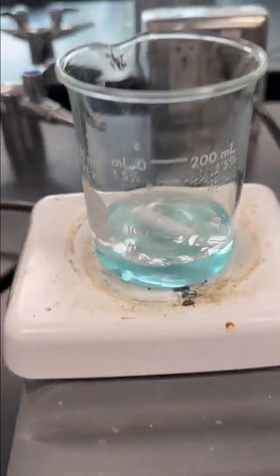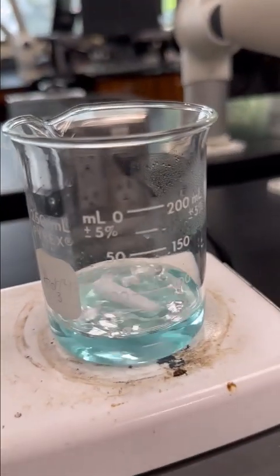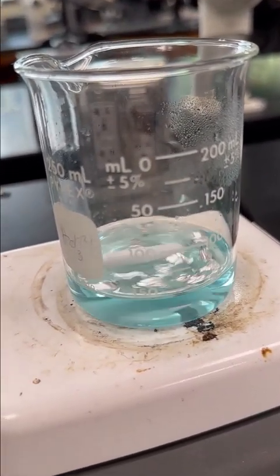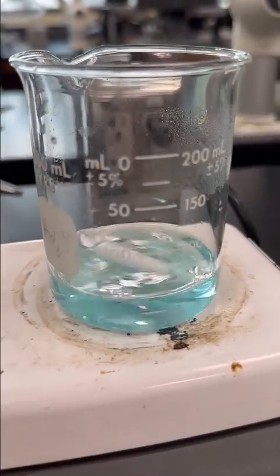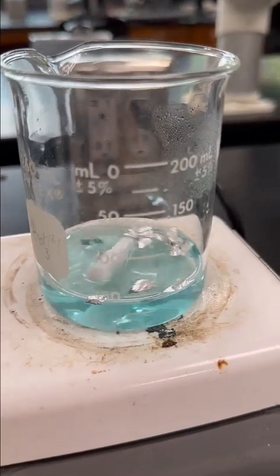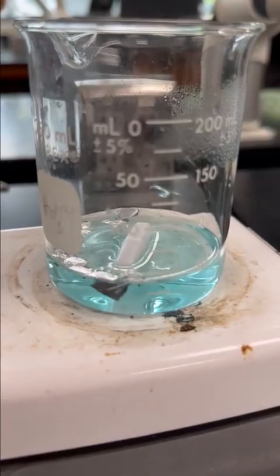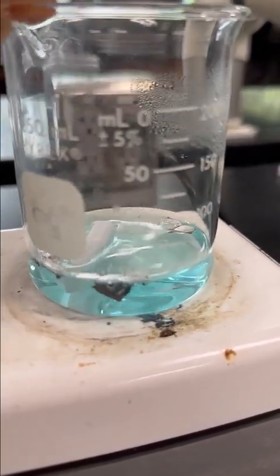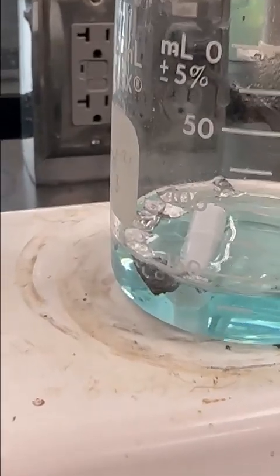All right, and here is the reaction with the aluminum foil. So we're spinning around here. All right, I'm just going to slow this down so that you can see this reaction going on just a little bit better. Maybe I'll turn it off for a second, just so we get a feel for what's going on in here. Okay, so here, let me get closer up here.